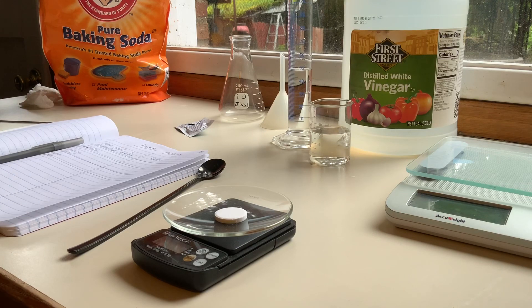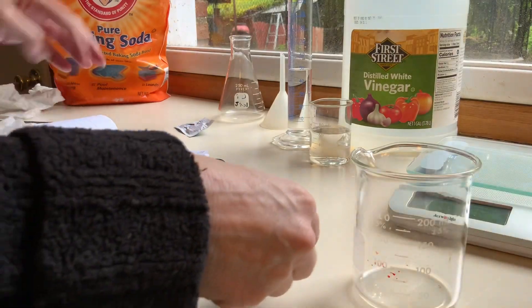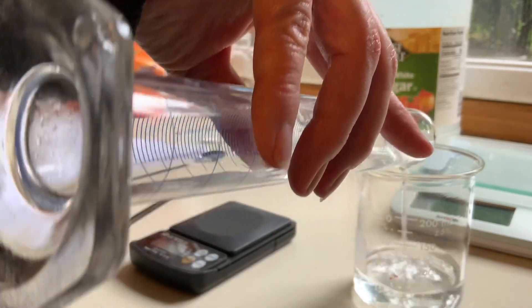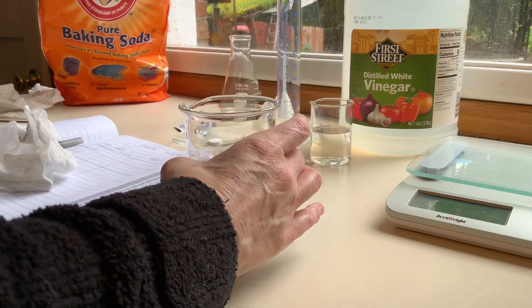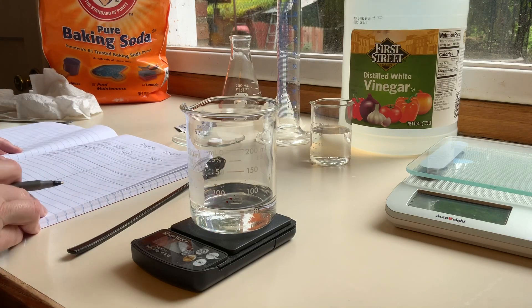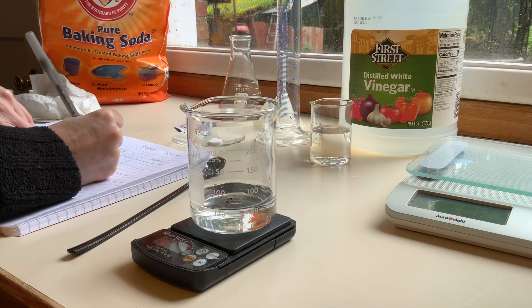This is Part B — analysis of an antacid. I've measured out my 50 mils of acid already. Here's my 50 milliliters of acetic acid. And I have to weigh these separately — 159.7 grams for the beaker with the acid before reaction.